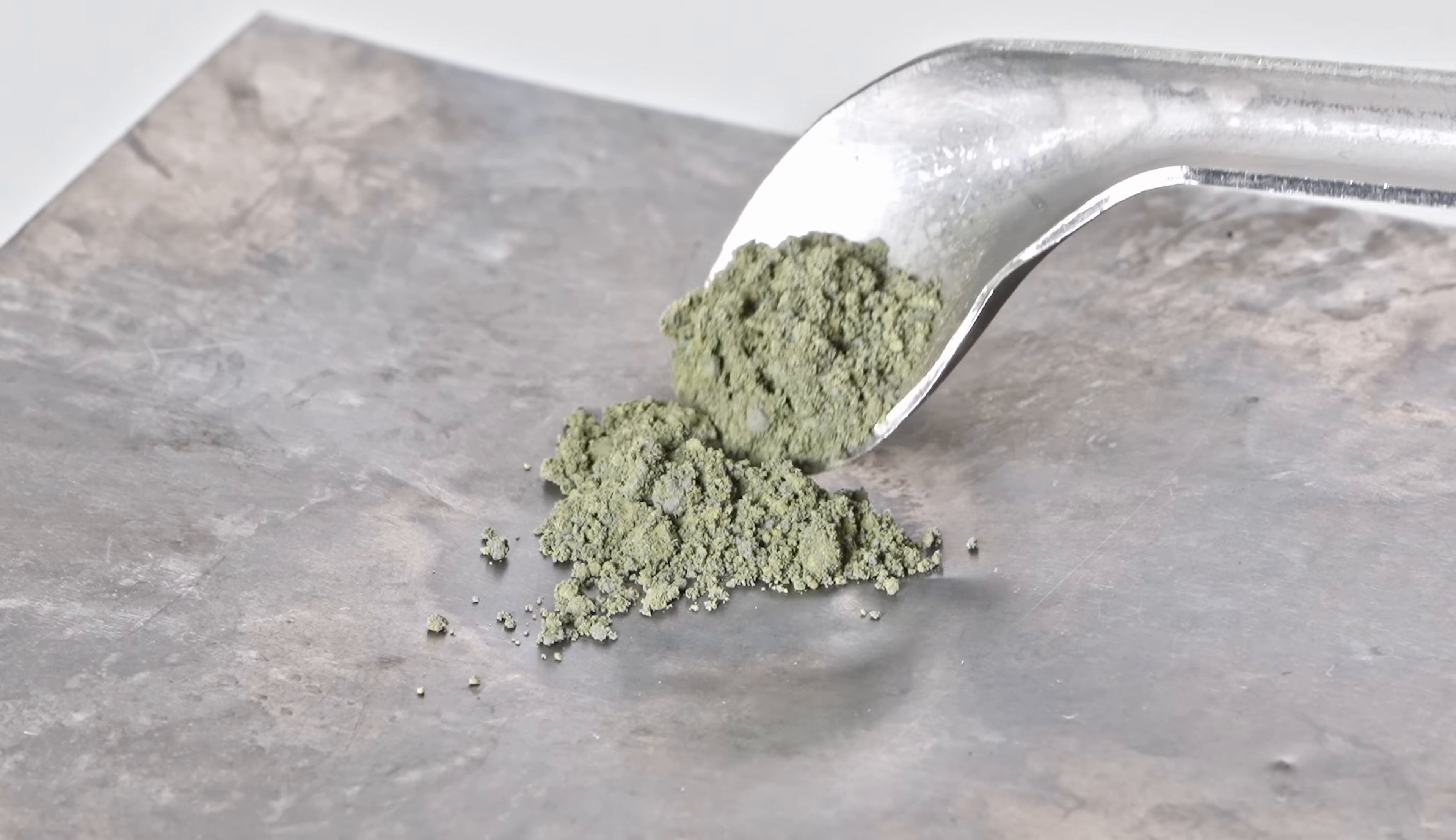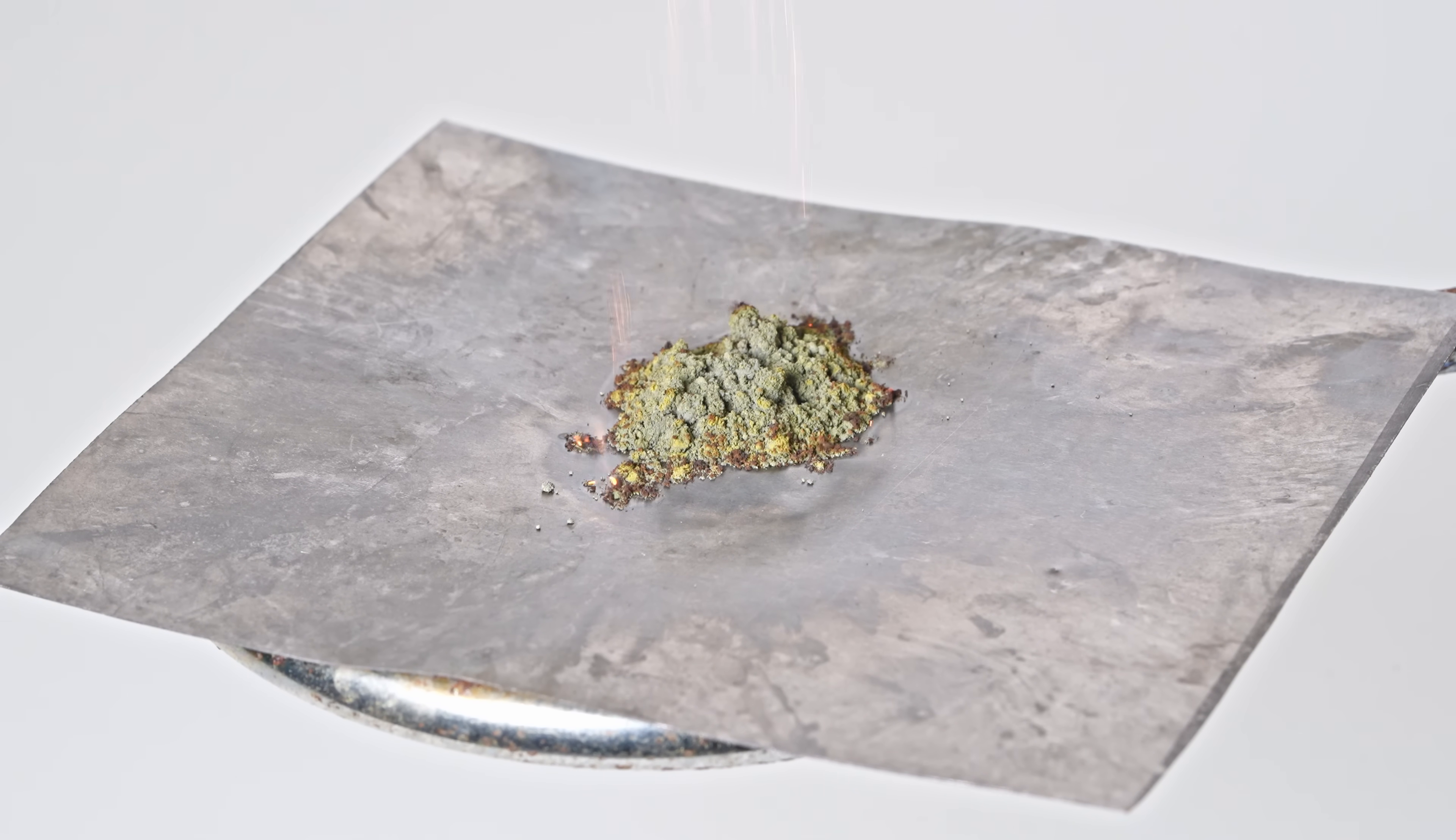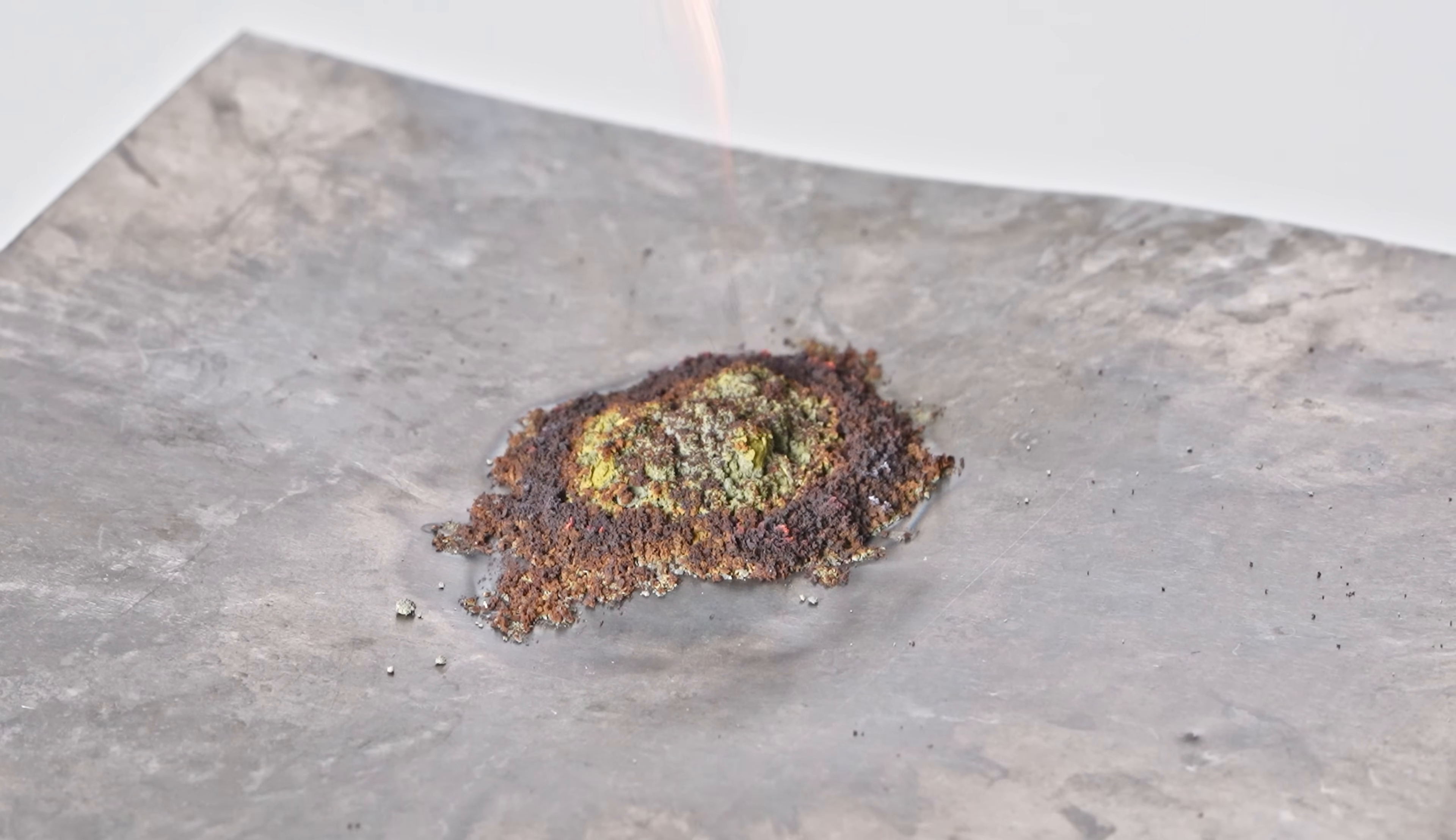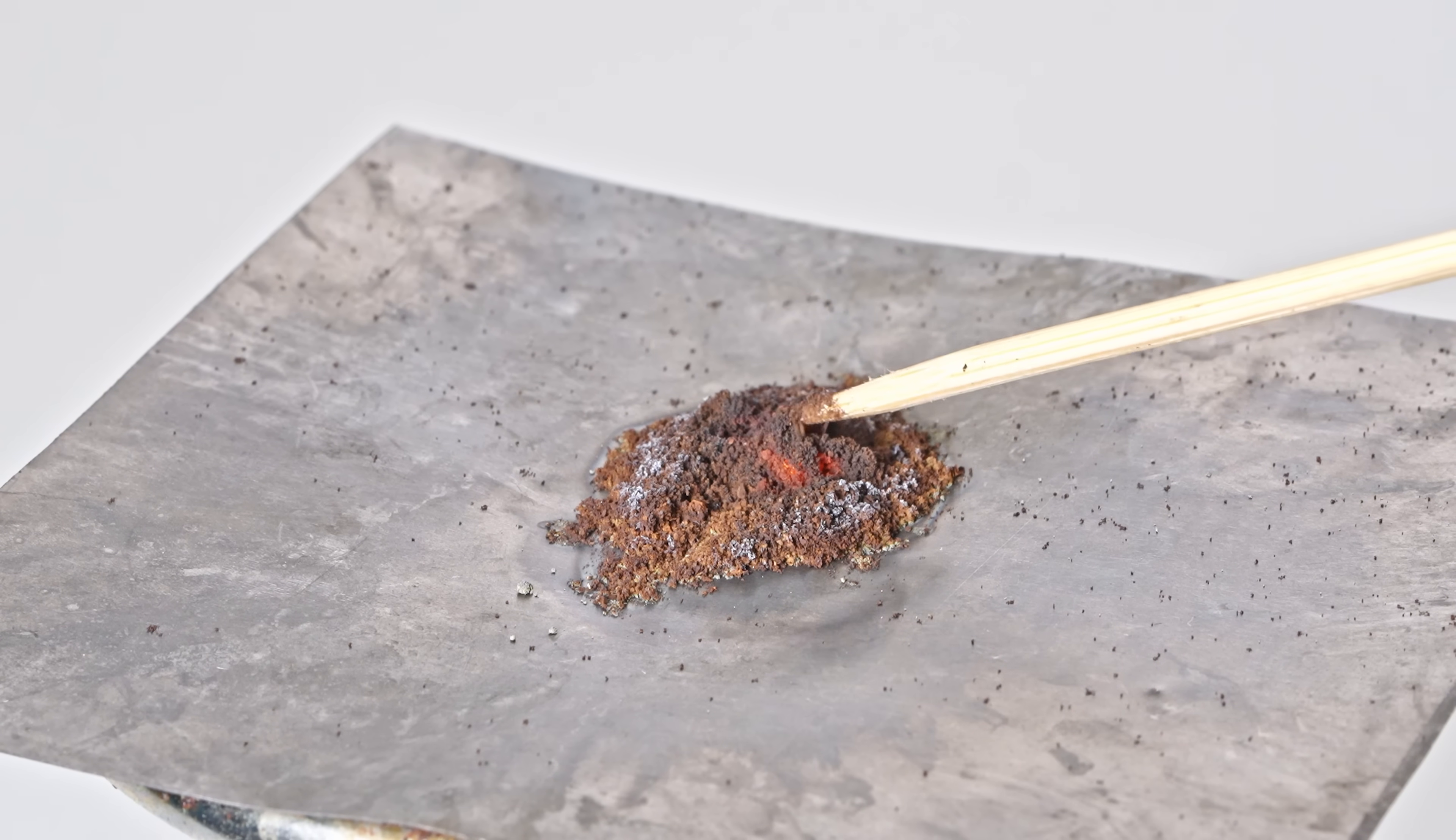Weirdly, siloxin is very flammable. It catches fire easily and burns smoothly. After burning, I got this orange-brown powder.